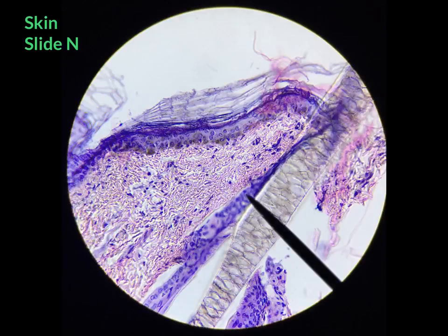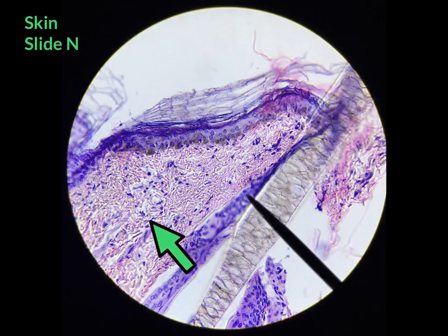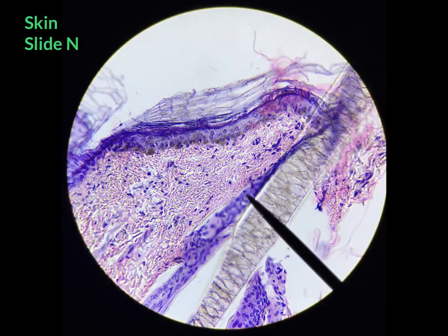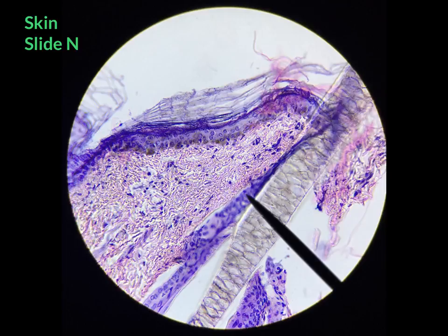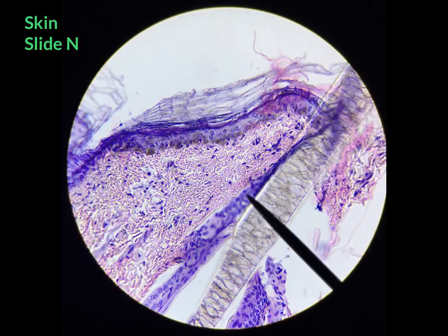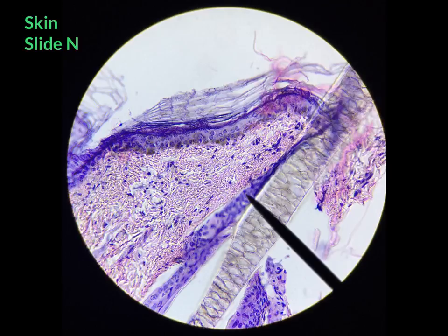Taking a closer look at dense irregular connective tissue, shown here in pink, you can see that the fibers are tightly packed with one another — hence the word 'dense' in the name. You can also see that the fibers are not running in parallel; they're running in different directions, which is why we also call this an irregular connective tissue.